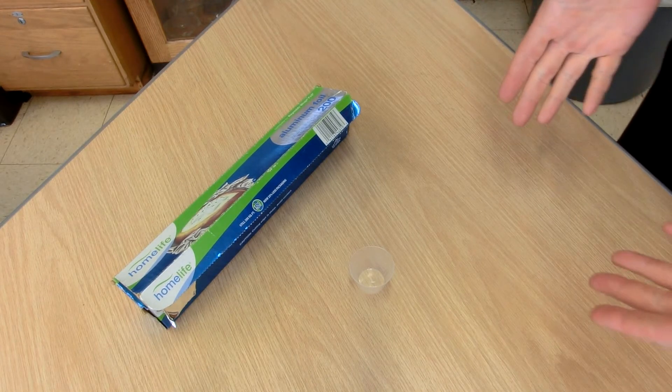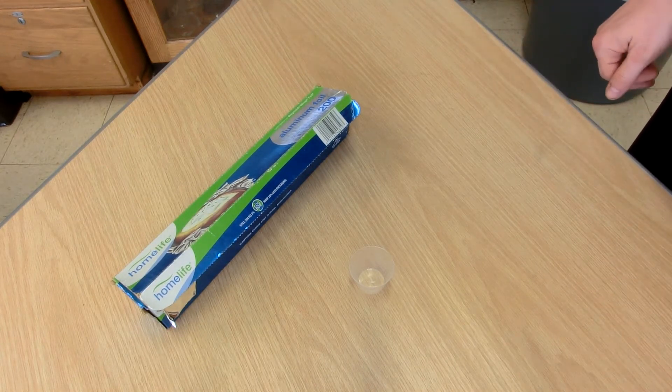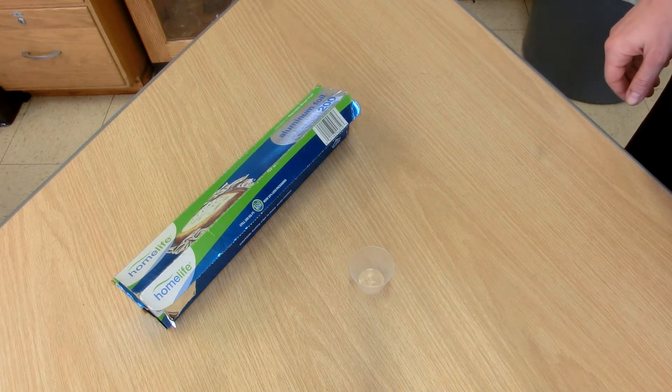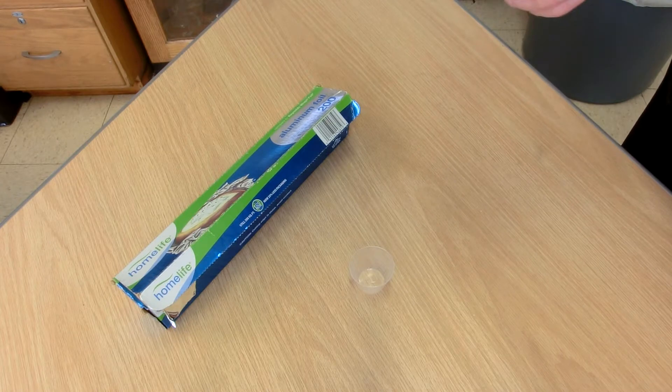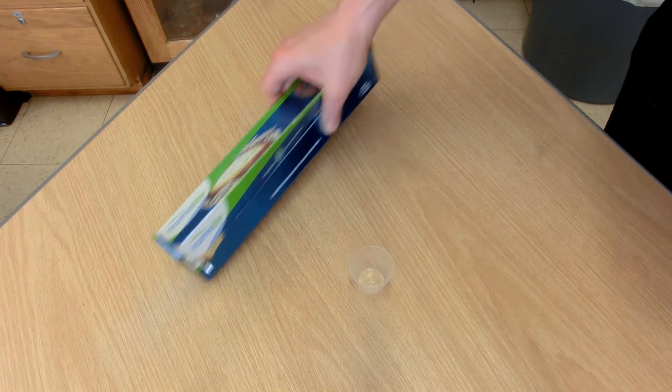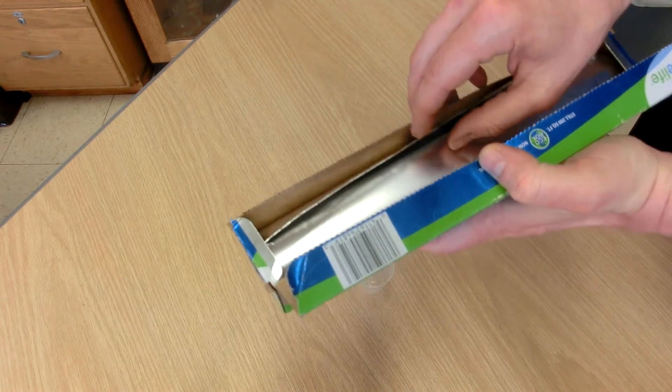I was in my chem lab the other day and needed my students to use a crucible. I didn't have my regular crucibles, but I remembered seeing in a catalog that you can buy aluminum crucibles that are disposable.